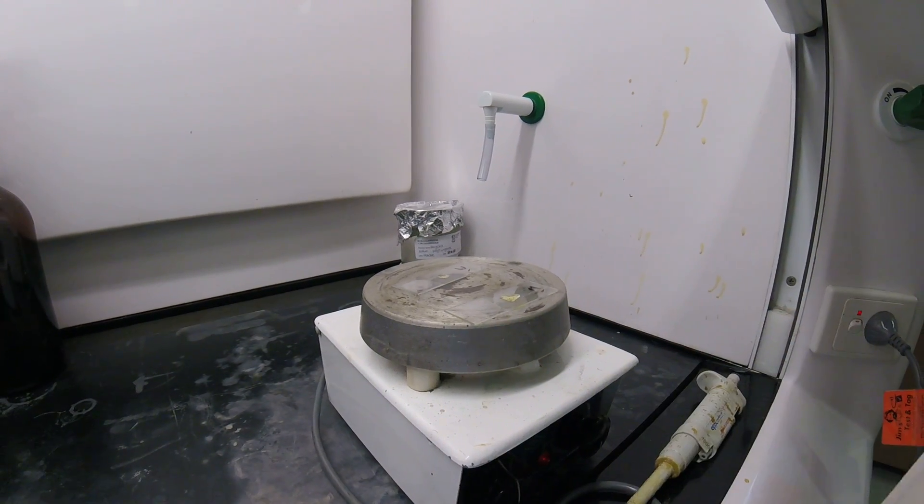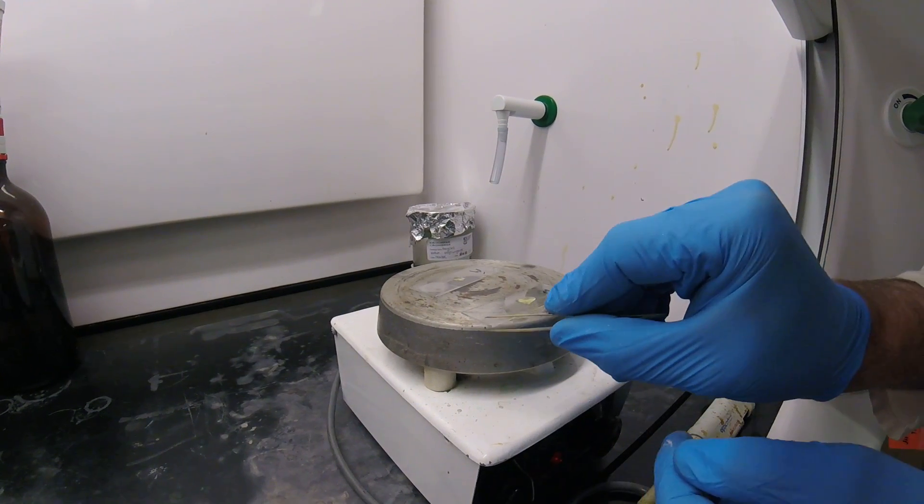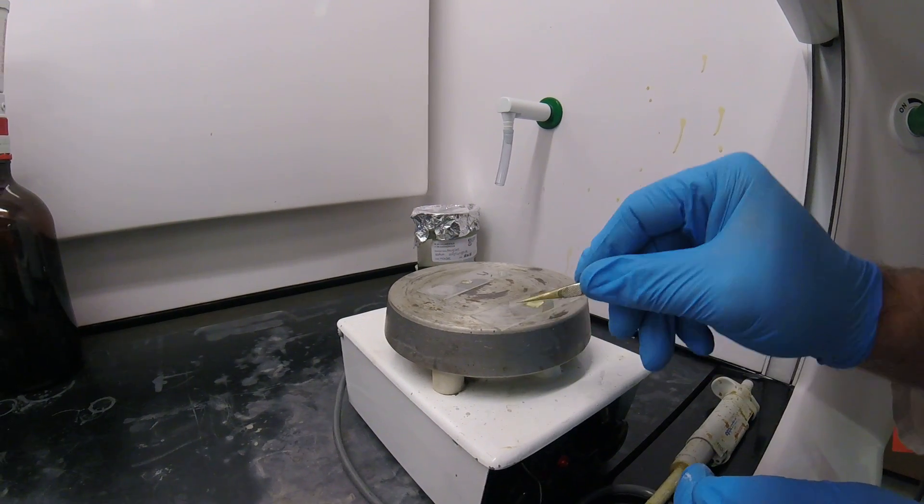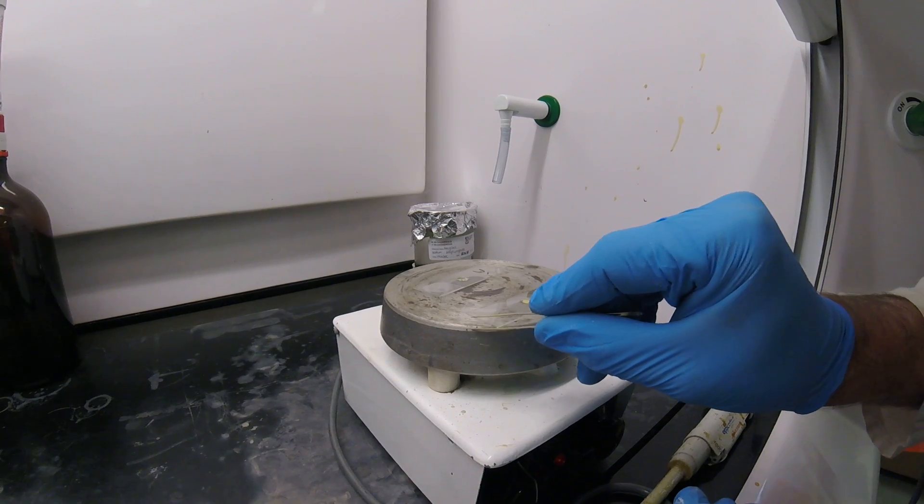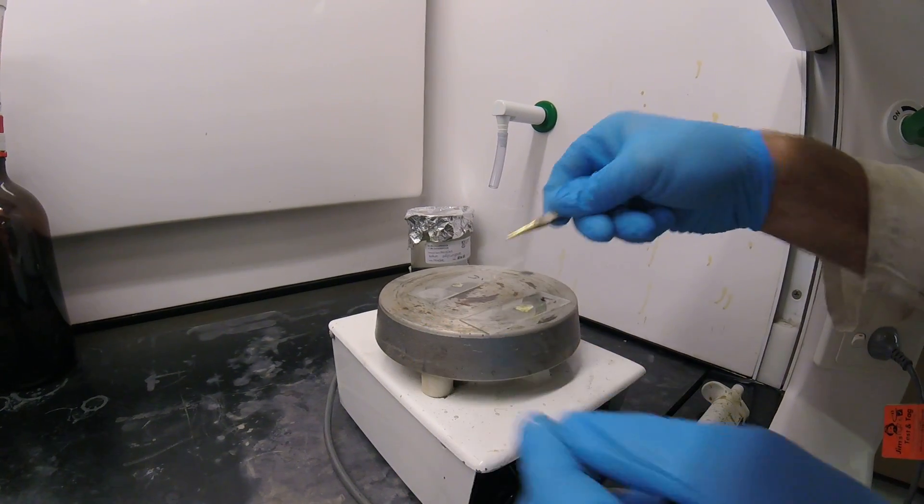Now I'll just grab a cover slip and invert it onto the slide, hopefully with a bit of luck. There we go.